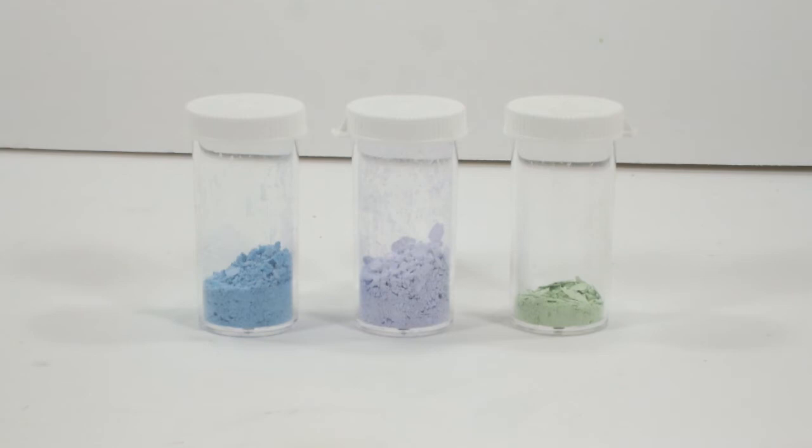Now on to that scraping. So here are the final results. The chloride complex yielded only 1.33 grams, which is 56% of the expected value. It's clearly more soluble in the acetone-water solvent though, so I think most of the loss happened there. The 90% yield on the sulfate complex makes up for it.